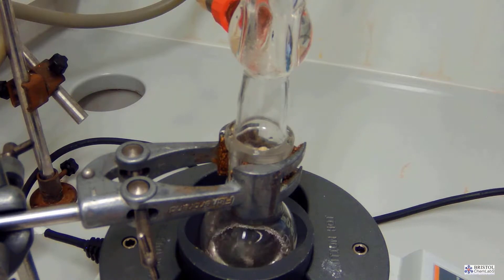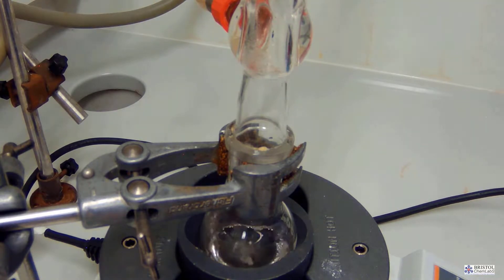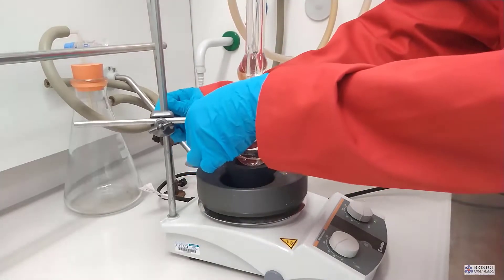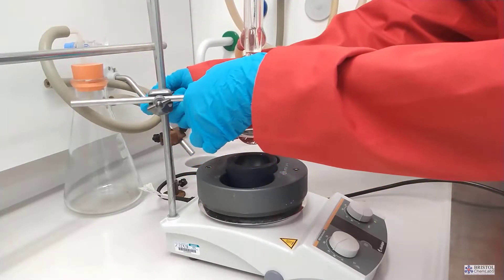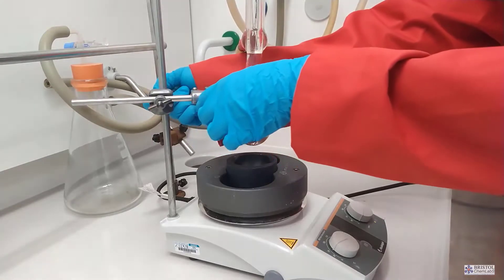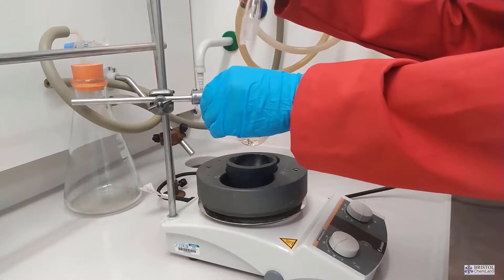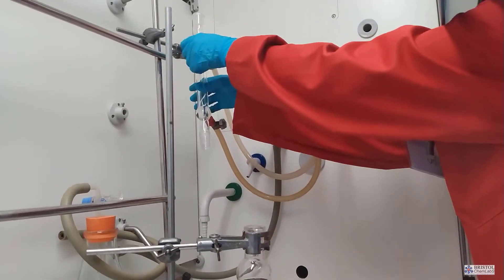In the laboratory that we're using here we have a chilled water supply permanently connected up to a condenser so we don't have to worry about using taps that may cause flooding. Once the reflux has been completed and remember the time for reflux has been calculated by numerous previous experiments we can then proceed to let the reaction mixture cool down ready for the next step.